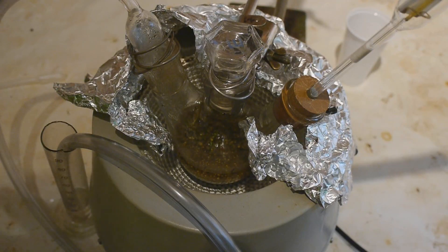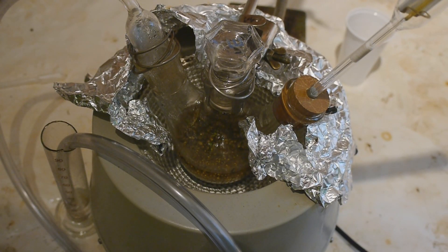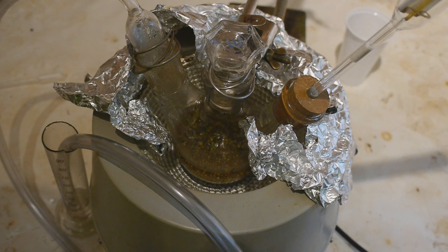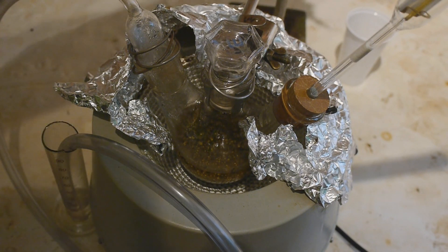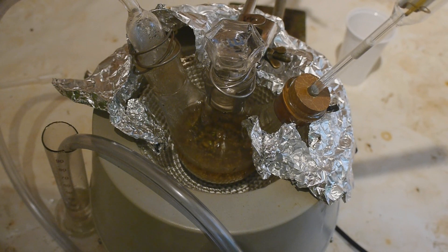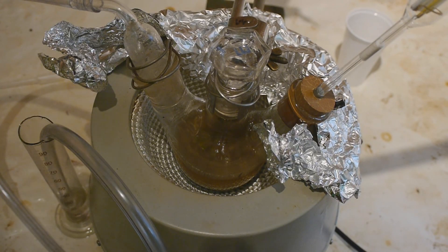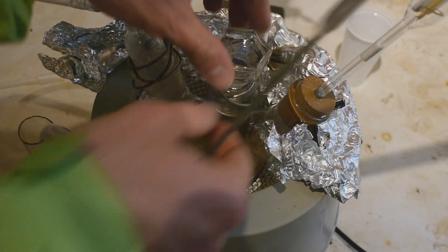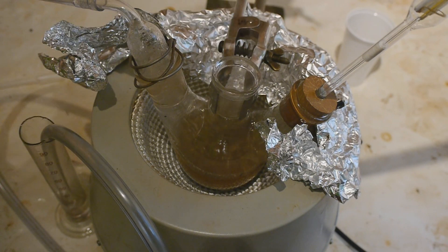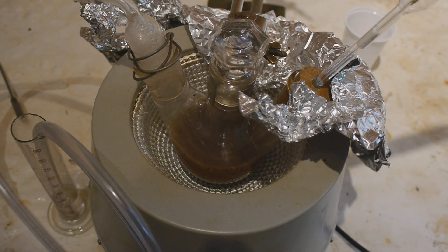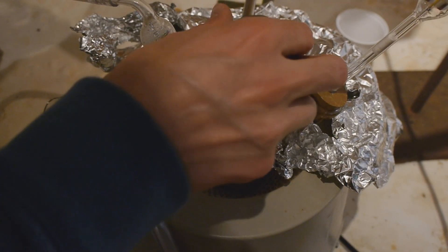This is now about 3 hours later. The temperature is now 210 degrees Celsius. And as you can see we have formed lots of spheres, little spheres of sodium which is good. But it's a bit problematic that I was having trouble with the stirring all the time. And it looks like it hasn't stirred properly. Yeah the stir bar seems to be stuck. Let me just try to help that a little bit. Oh it's hot. The oil is smoking hot. The stir bar is refusing to work.